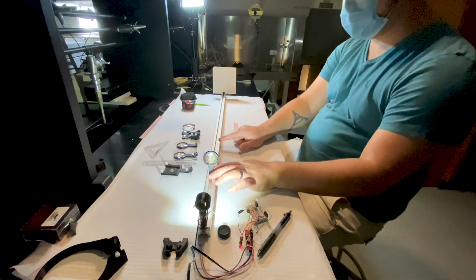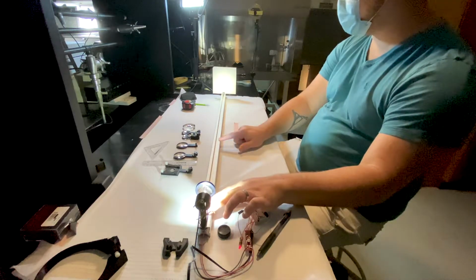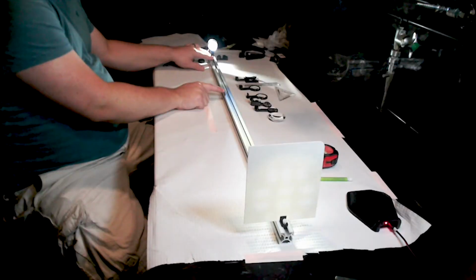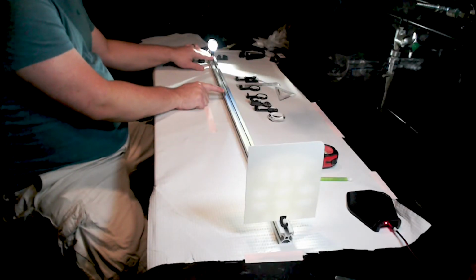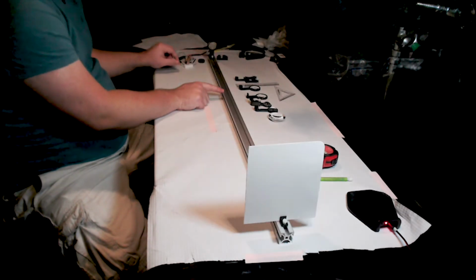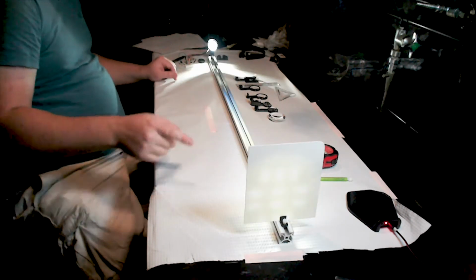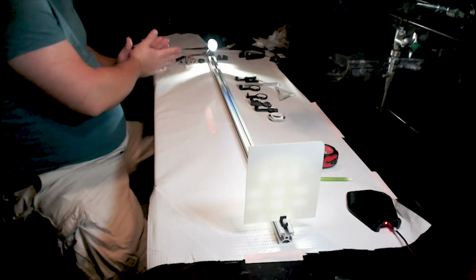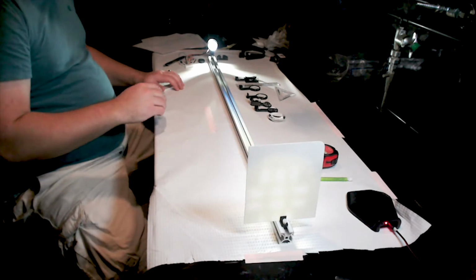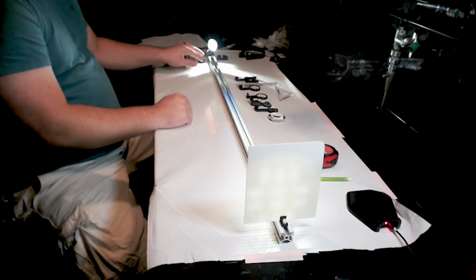Now, as I move my eyepiece objective, you can see that something begins to form on the paper. Now, what does that look like? Well, if you turn your LED off and then look into the LED, you'll actually notice that that is an image of the LED itself. These individual bright spots are the individual light sources. This is a multi-element LED.